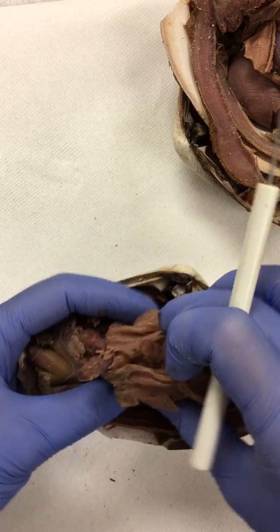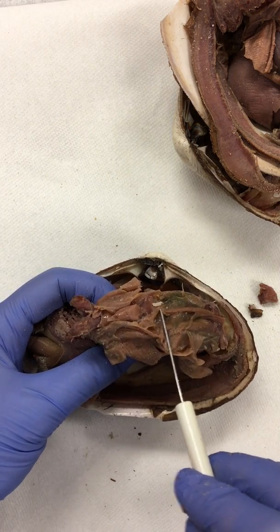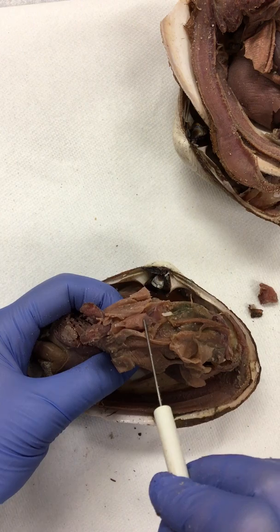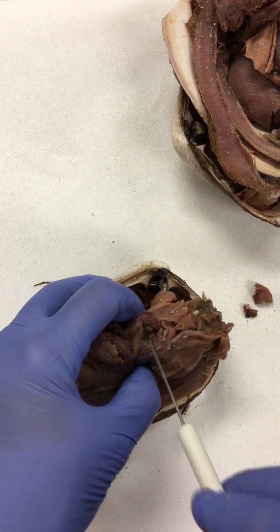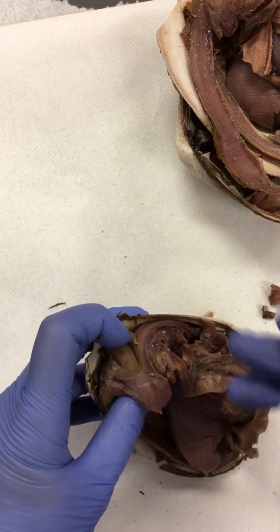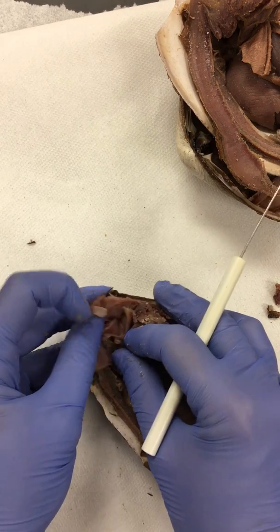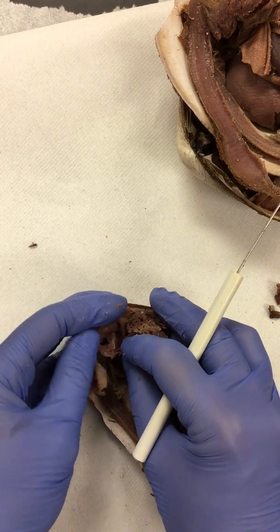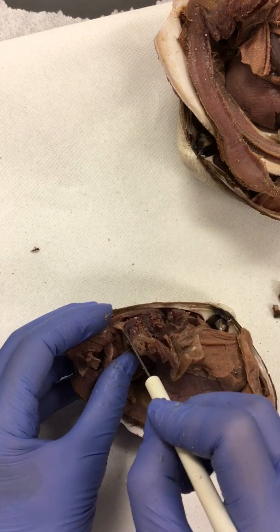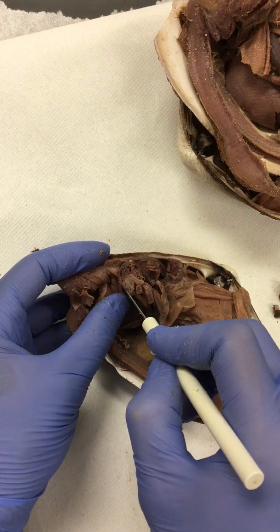Again, we have a heart, and here's the heart structure where it's going to pass waste. Remember the labial palps, so this is anterior. The intestines will come up here, travel this direction, around to the excurrent siphon, and then release waste in this area. And over here, if we pull it apart a little bit, you can see more or less the area that it would come from. This is where the anus is going to release any products that it is expelling out of its body.